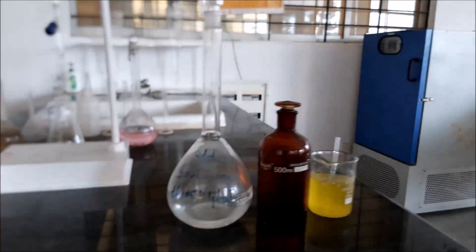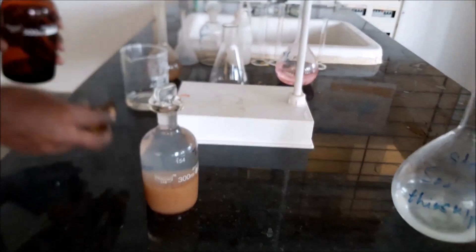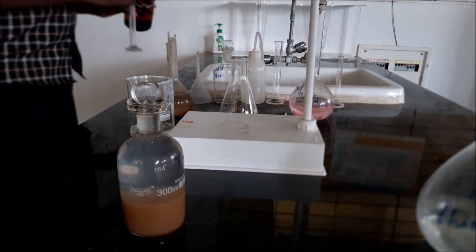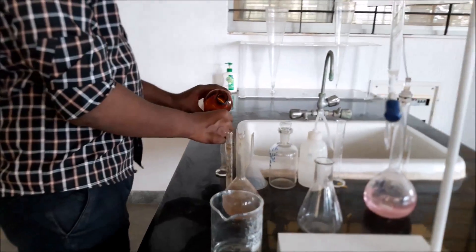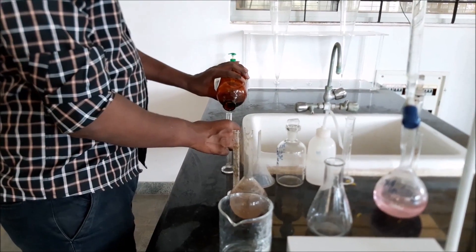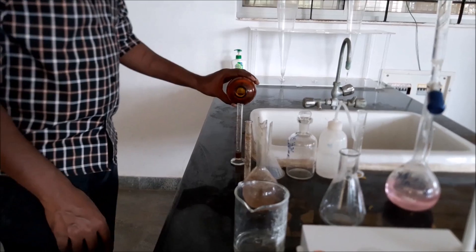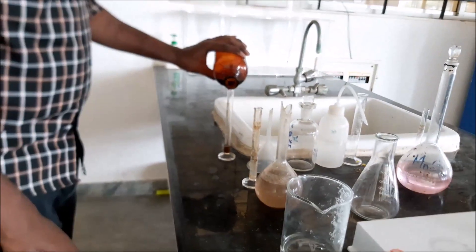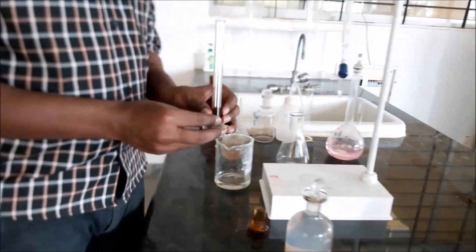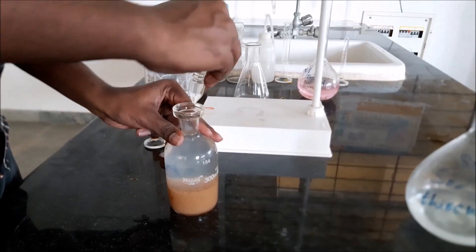Now we will add concentrated sulphuric acid. 2 ml of concentrated sulphuric acid is added to the sample after the precipitation.